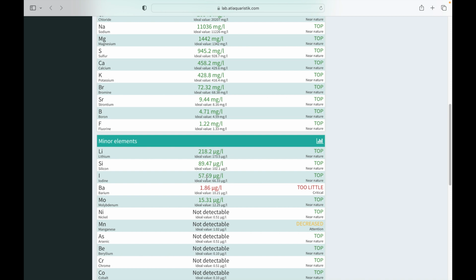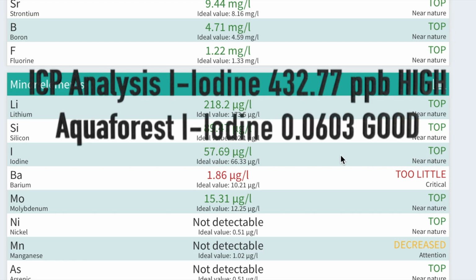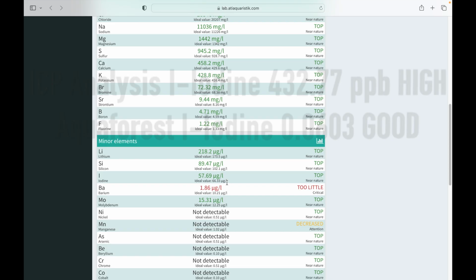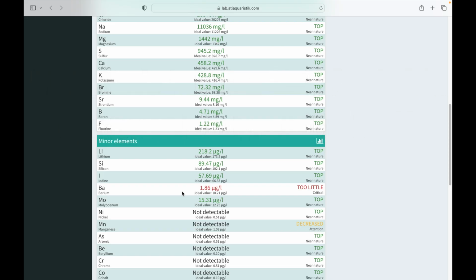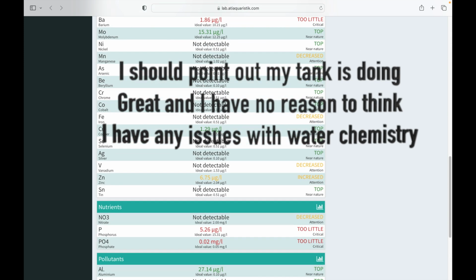And now here we go with ATI showing it in normal range, near nature. So is that iodine reading wrong? It must be. I would think so. And what if I don't know. All right, this is just low. I'm not going to comment really on these conflicting test results yet.